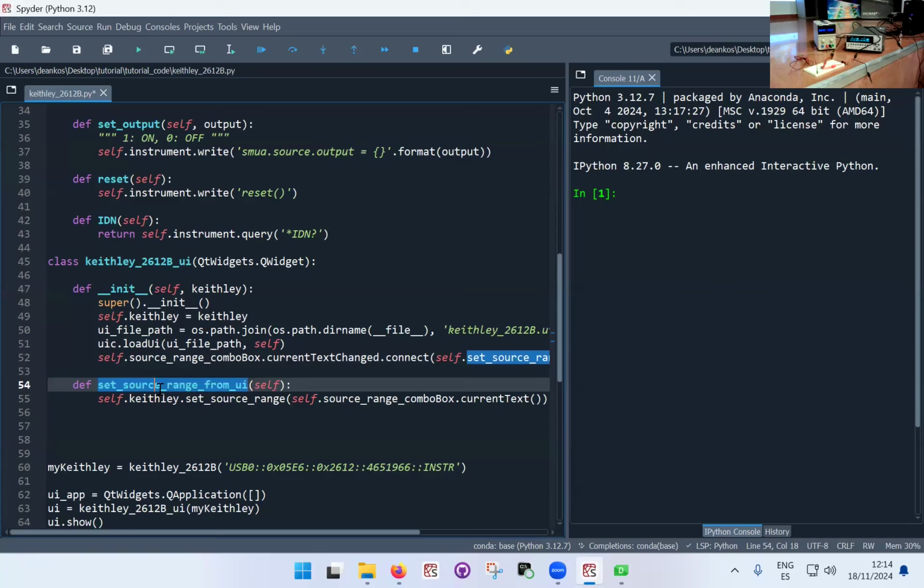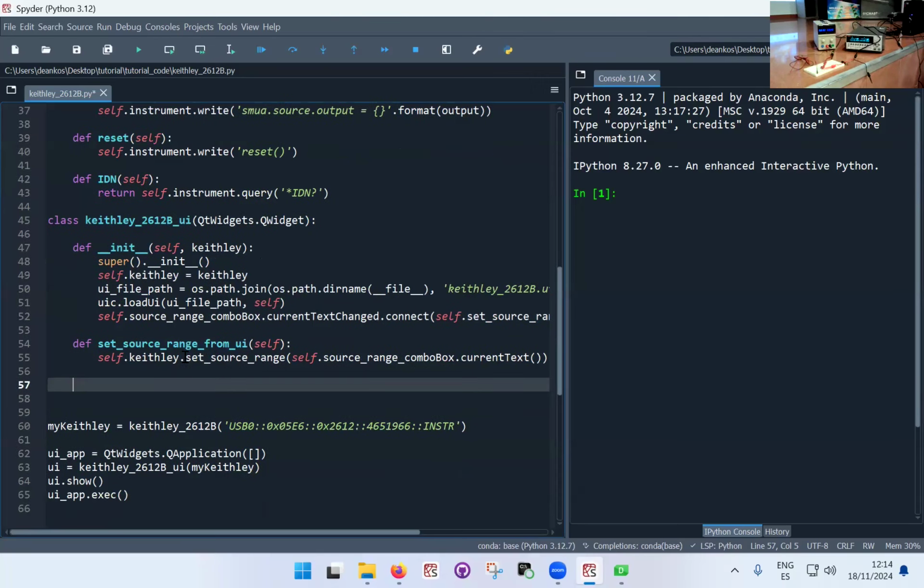There might be other cases where, for some reason, all these things that I'm doing now, sort of programming the interface and connecting to the interface, I could do the reverse and generate the interface from the program. So it allows you to do that. Now I'm going to implement maybe another one, maybe the one with the button that is a little bit more obvious because a button is something that I generally have to click.